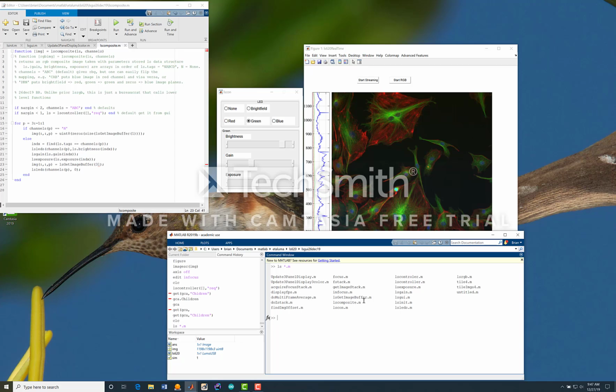ls get image buffer communicates with the DLL, and it returns the next image buffer from a ring buffer. You can give it a parameter of up to 3 to throw out previous images in that buffer that will guarantee that the image you're getting back was taken after the function call. ls composite is the function that was called to generate a composite image, so it returns an RGB image.